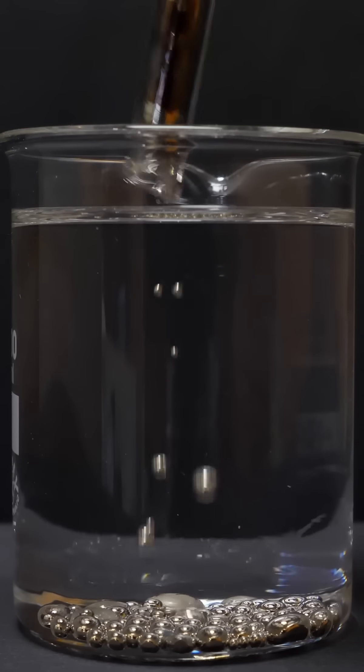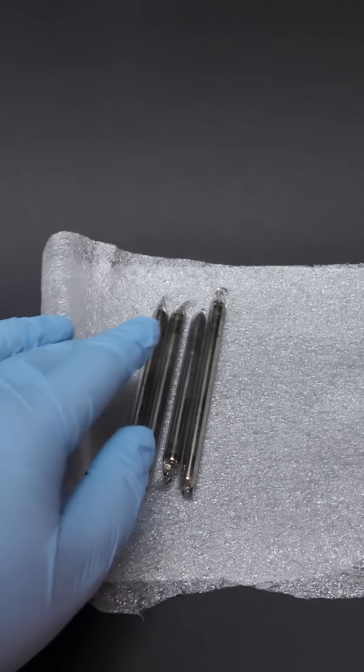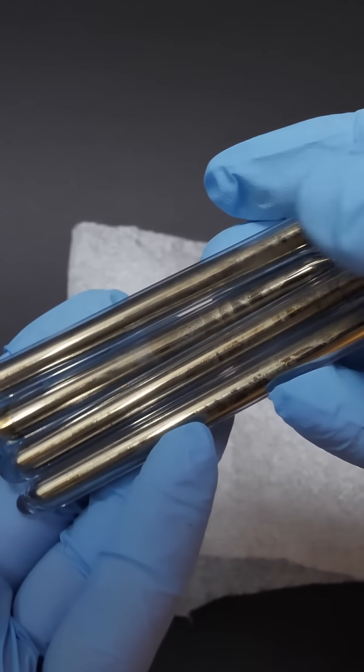This here is the most reactive metal in the world, cesium. This substance laughs at sodium and what the reaction looks like I'm about to show you right now.